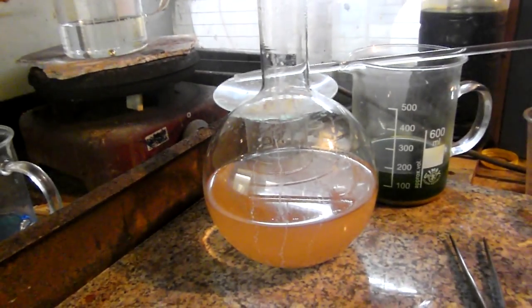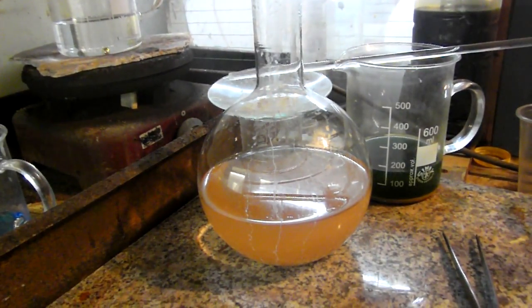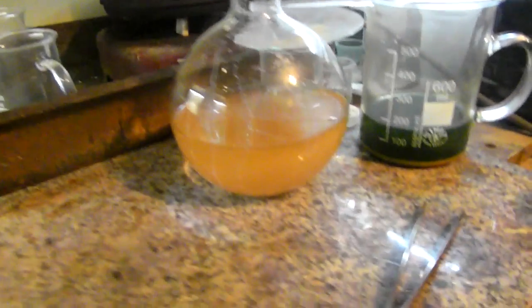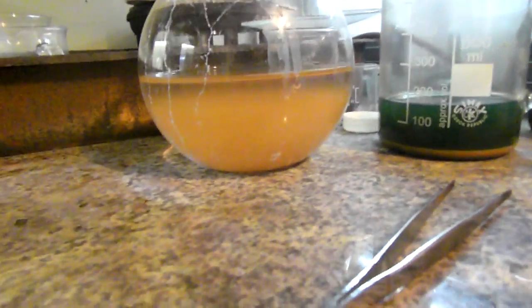While I was melting the bead, the decanted solution in the round bottom flask had turned light brown and cloudy, and more gold had precipitated.